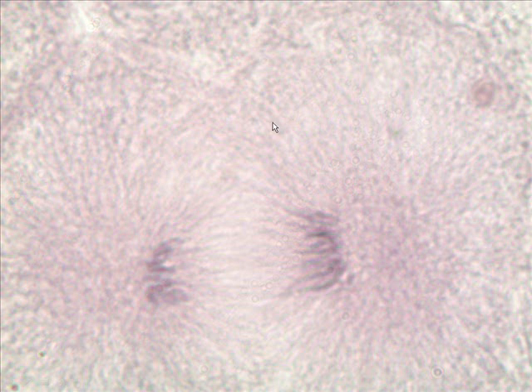Now, where are we? Well, you see the cell starting to divide. Is that pinching in up there? Pinch, pinch, pinch. Yeah. And so we are in very early telophase. You can almost say we're in extremely late anaphase or very early telophase. And so here's the cell dividing again. Here's the unduplicated chromosomes at each end of the parent cell.